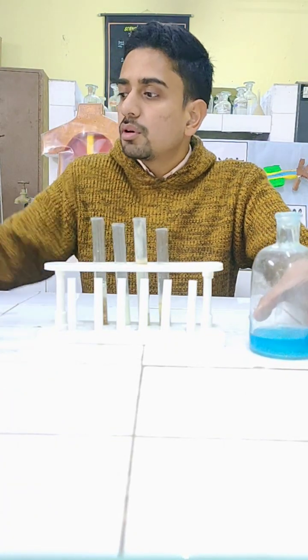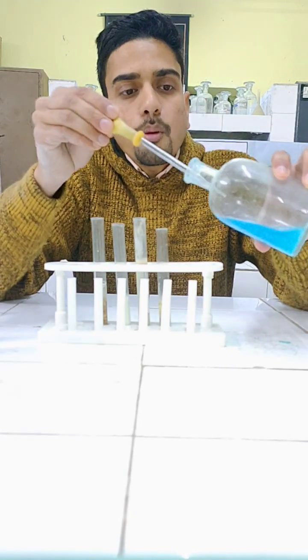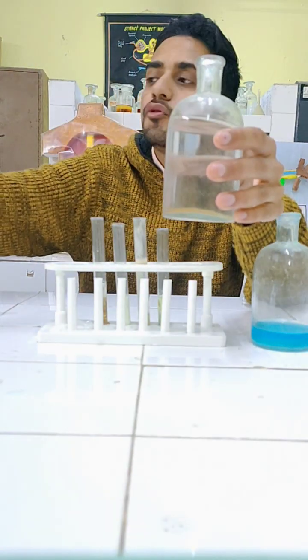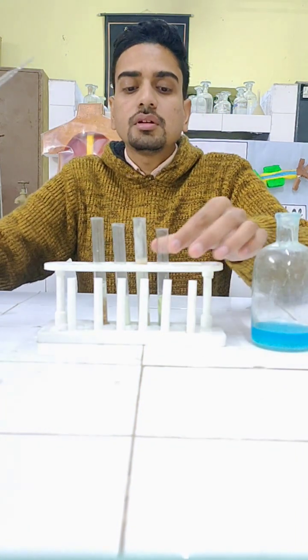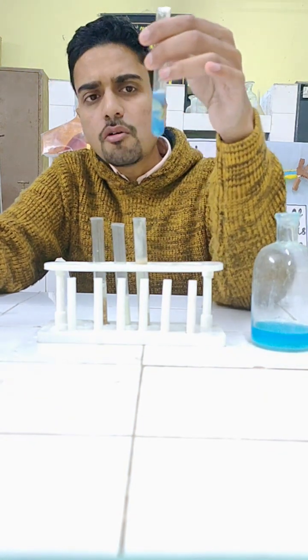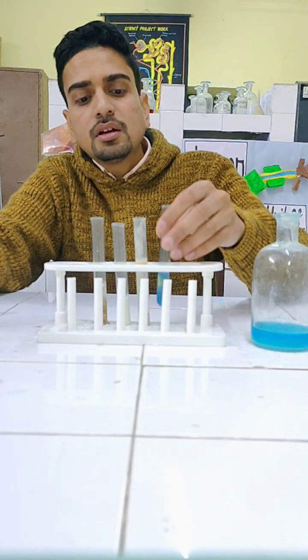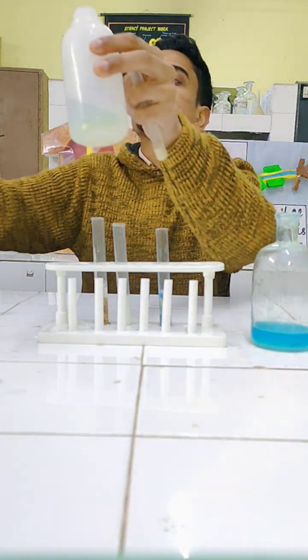To check, we will use this dropper — two drops of copper sulfate and ten drops of caustic soda into the potato sample. There is no change in color; copper sulfate is still blue. So it means there is no protein in potato.